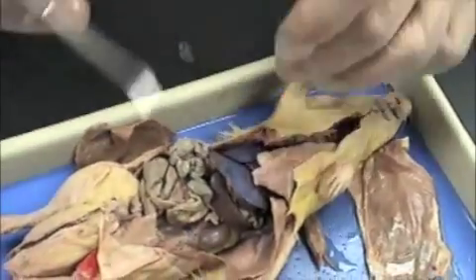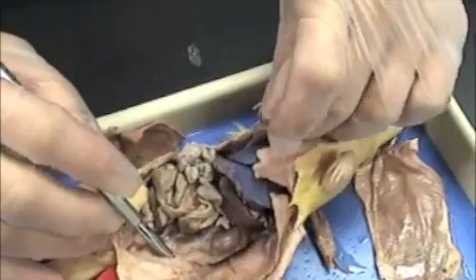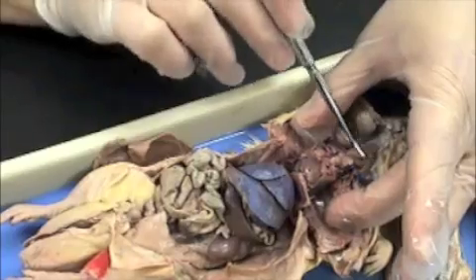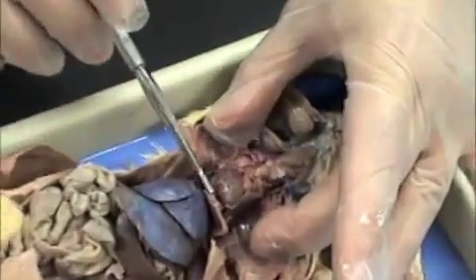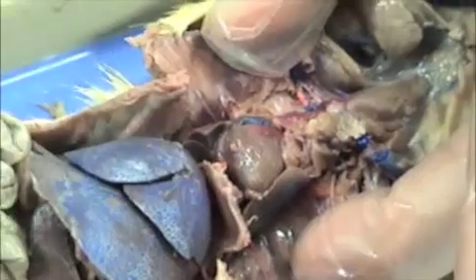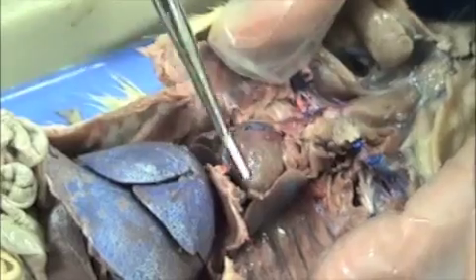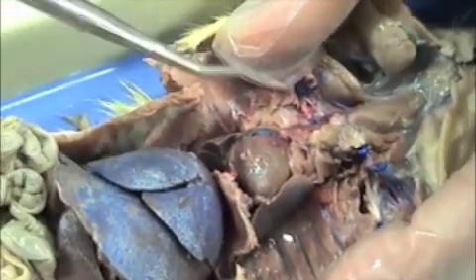Then we want to look inside of the rat. If we hold these ribs open, we see several organs in the thoracic cavity, and you have your abdominal pelvic cavity here. The diaphragm separates the thoracic cavity from the abdominal pelvic cavity.